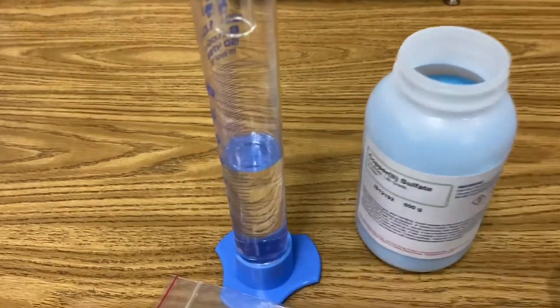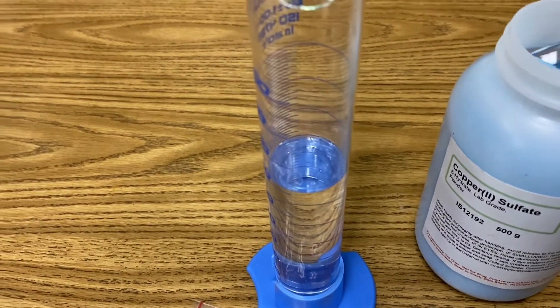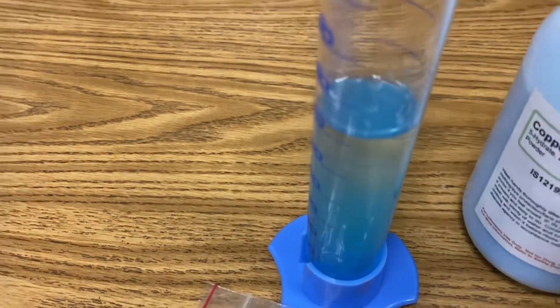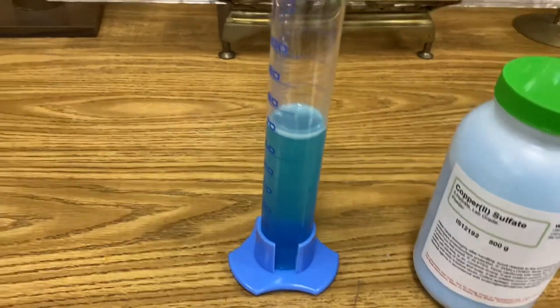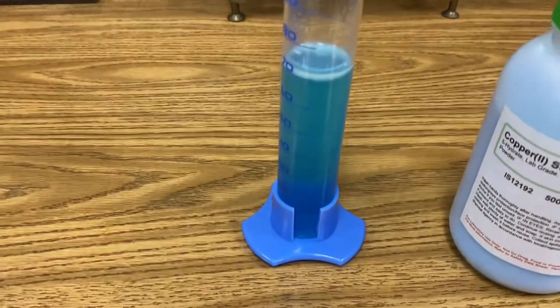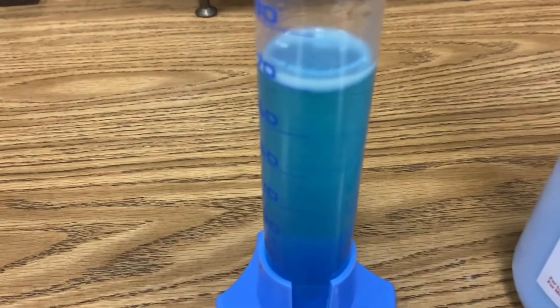Begin by creating an aqueous solution of copper 2 sulfate and make sure that it completely dissolves in your graduated cylinder. Once the copper 2 sulfate is completely dissolved in your distilled water, take a strip of magnesium and add it to your solution.